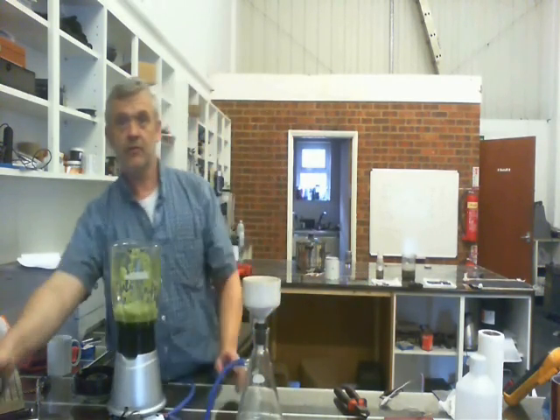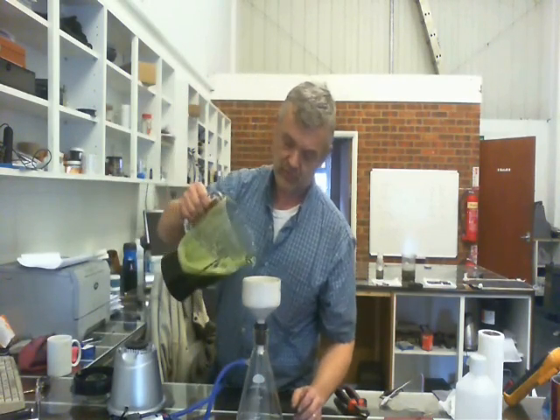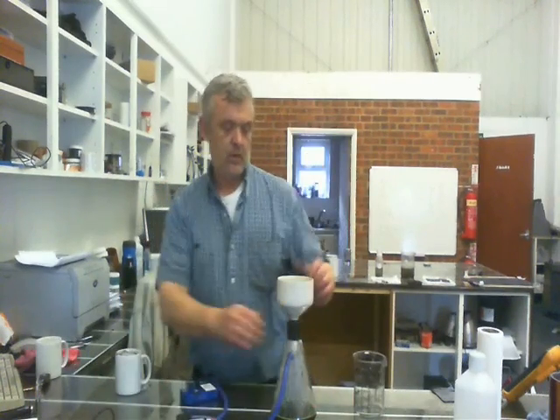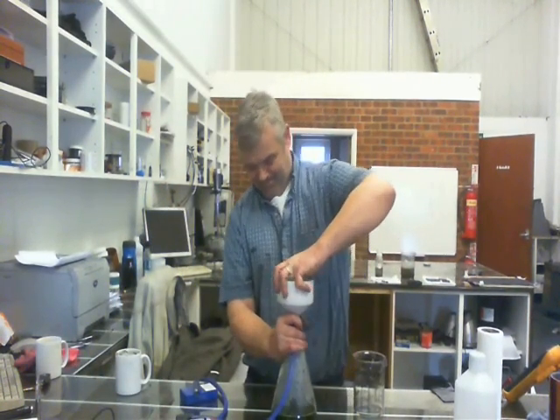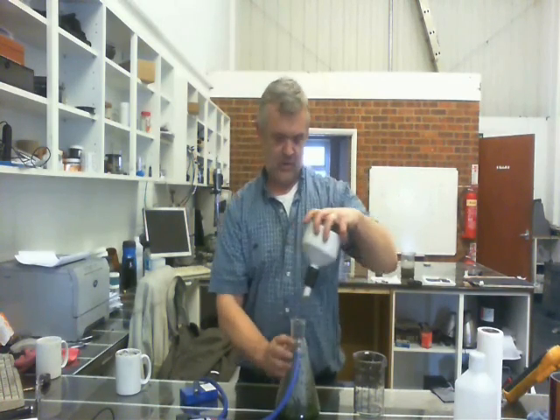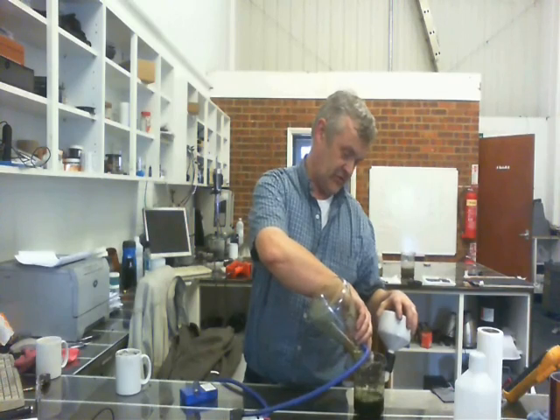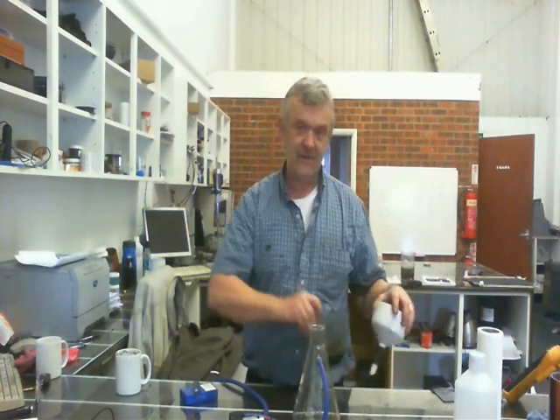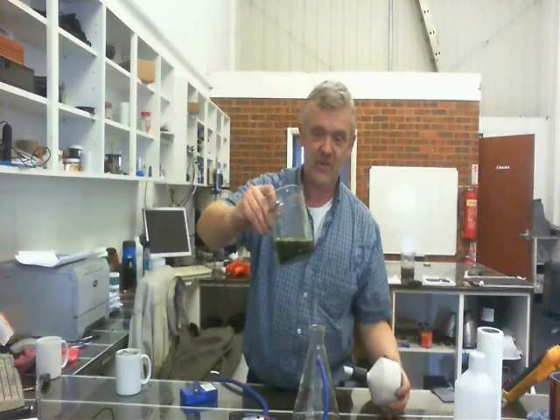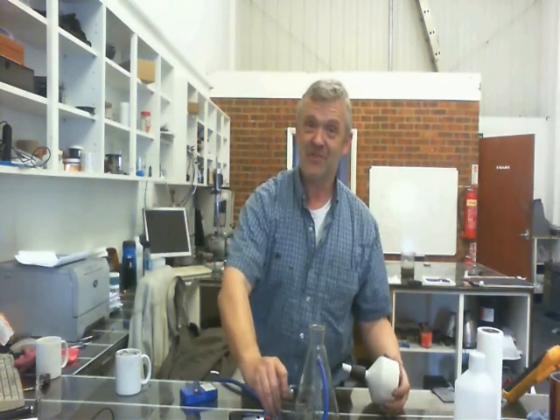Turn on the pump and filter it. When you've filtered it, pour it out. This got filtered twice because I wanted to make sure there are no bits in it. And there it is — your nice green chlorophyll solution. Obviously there are other things in there, but there's definitely chlorophyll.